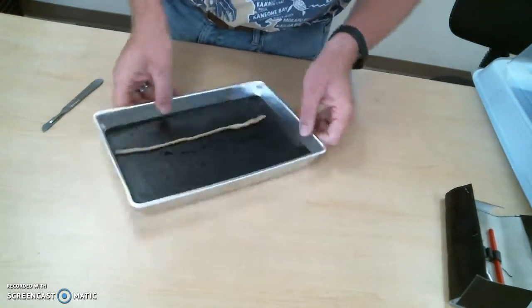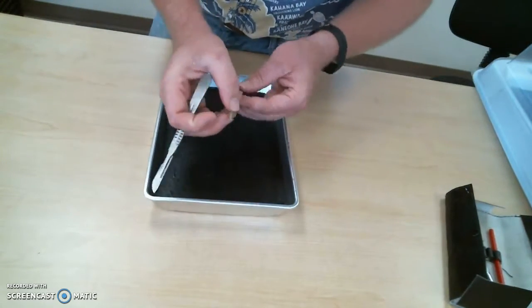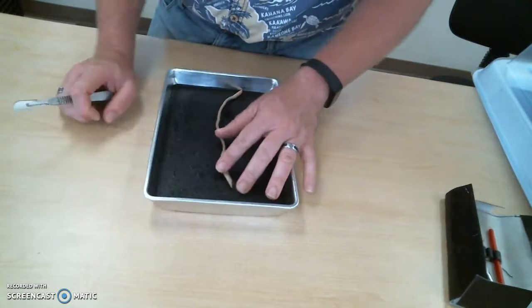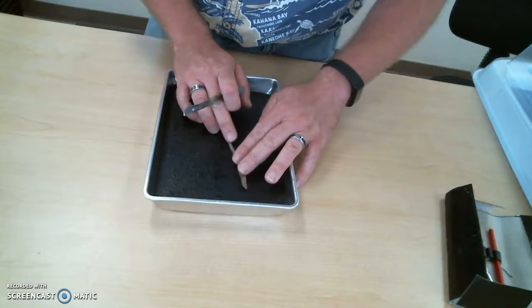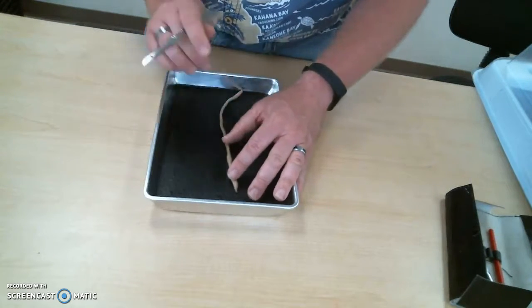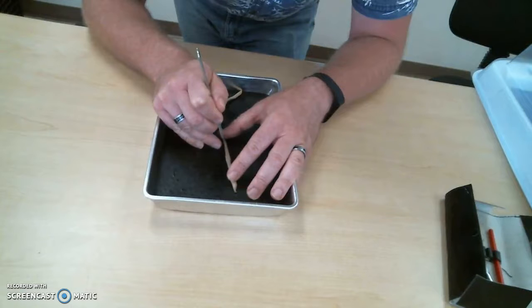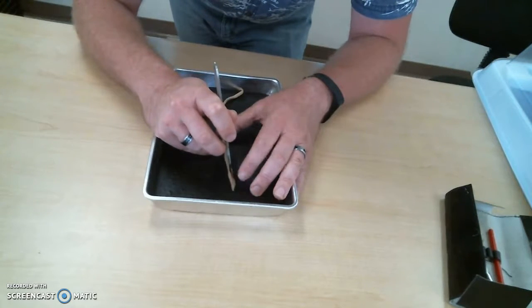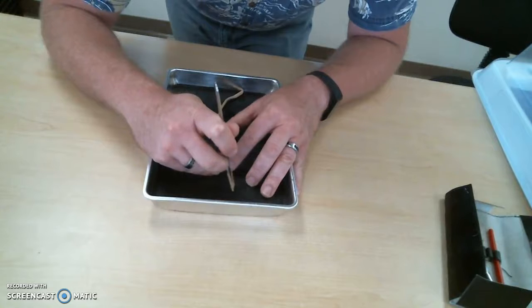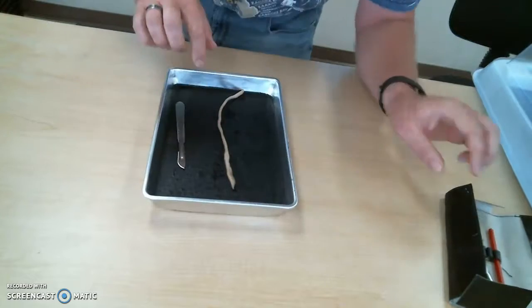When we cut into the worm, we did it mid-dorsally, and we started just behind the clitellum and went forward, and I'm going to try to do it mid-dorsally as well. So there's the ventral side. So this will be the dorsal side. And I'm just going to cut in here real quick, and then slice just through the skin up towards the head. Okay. And if I did that right, I should now be able to pin it open.